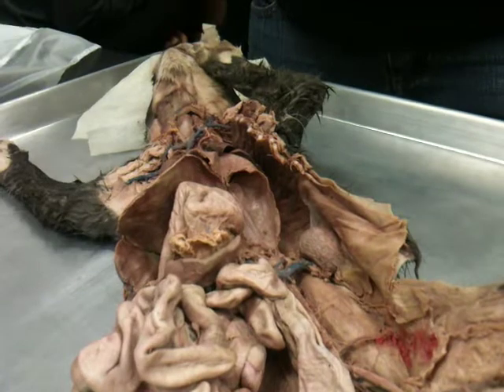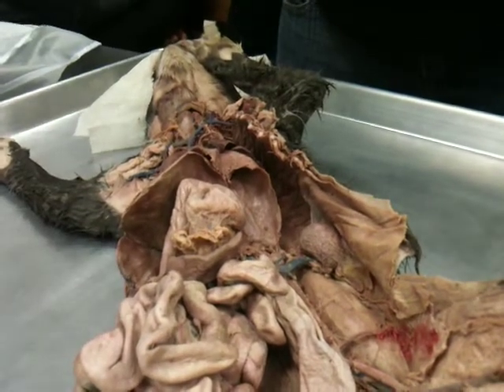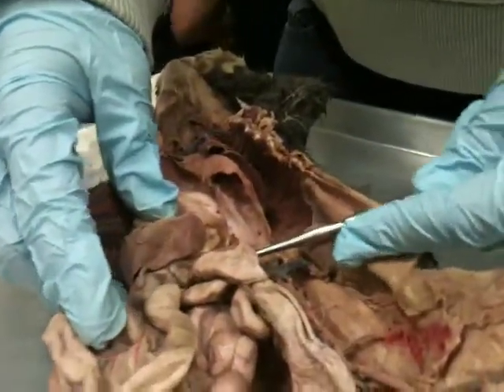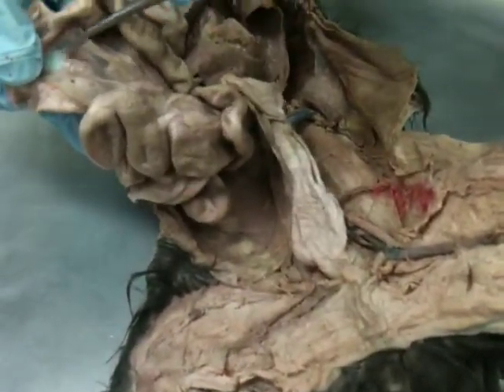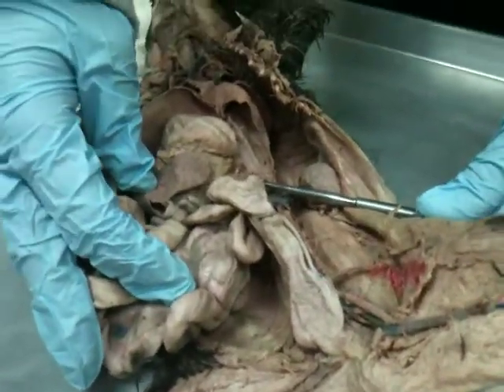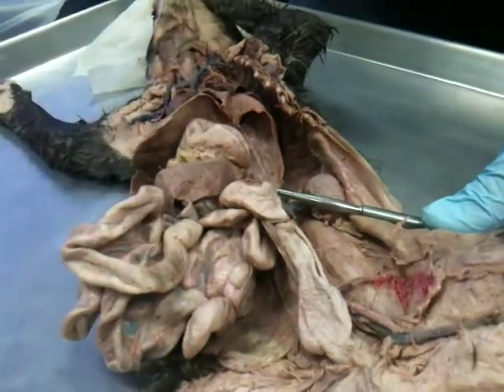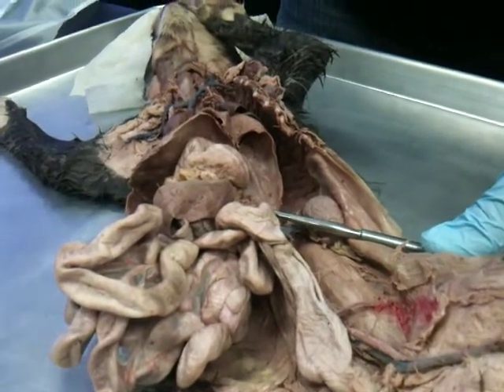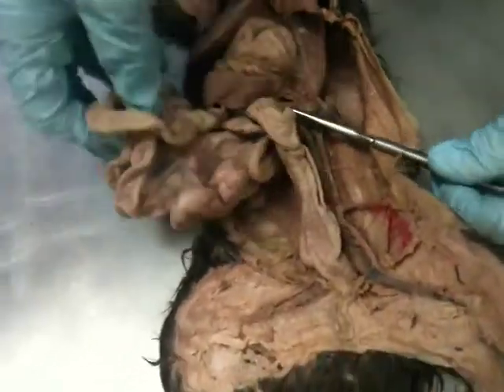When you think about the pulmonary trunk going to the lungs, it has several branches that are actually connecting to the lung tissue. Okay, and then we have this lower branch coming off the aorta, and you can see it's going to the intestines, and the intestines' mesenteries. Remember, the connective tissue is called the mesenteries. So what's this called? Mesenteric. So the mesenteric artery, right? And with this, I'm not having you differentiate between superior and inferior. So if you just put mesenteric artery, that's fine. That's basically what's going to the abdominal cavity. And there are two of them because they're going all to the intestines, so there's a lot of tissue to be supplying blood to.